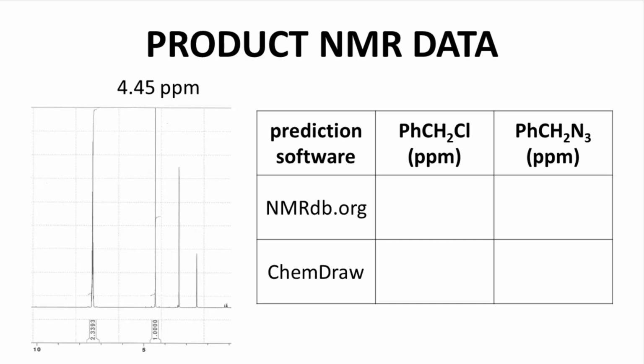These simulations are often quite good, although not always. Here are predictions from a website called nmrdb.org. The CH2 group of benzyl chloride is predicted to be at 4.59 ppm, while benzyl azide is 5.05 ppm. My product, with a shift of 4.45, would seem to be closer to benzyl chloride than benzyl azide. That's not what I want to hear.